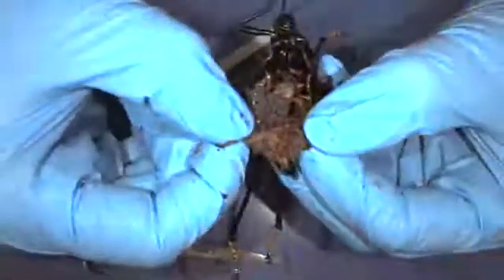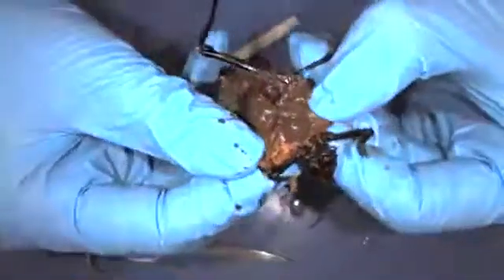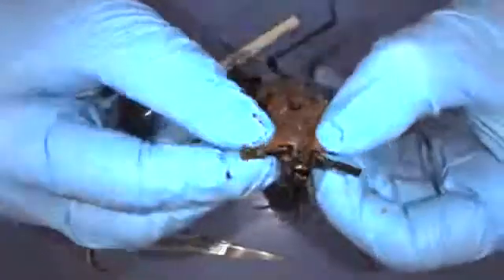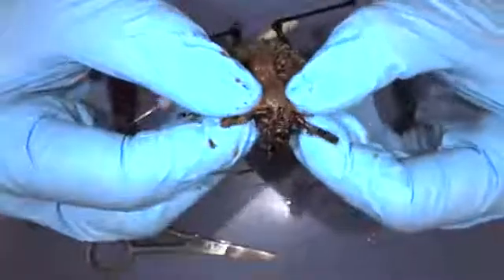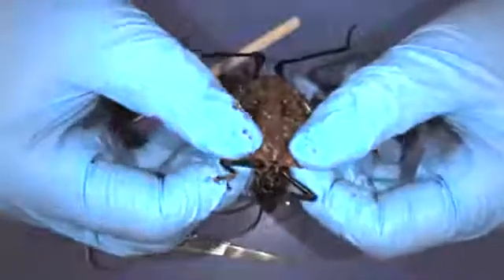Inside their body they do have some important organs. Up here at the front, if you can see that little bulb, that is called a crop. A crop is a digestive organ that we don't have in our body, but insects and even birds have one. It's another part of digestion — in birds they use it to help break through seeds and things like that.